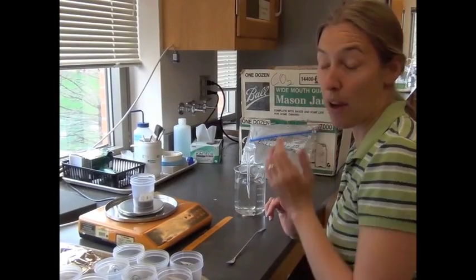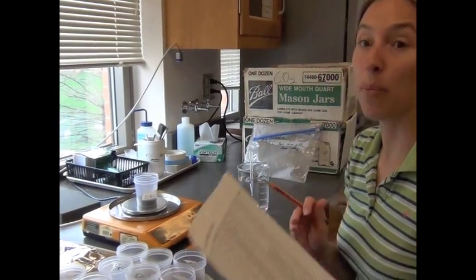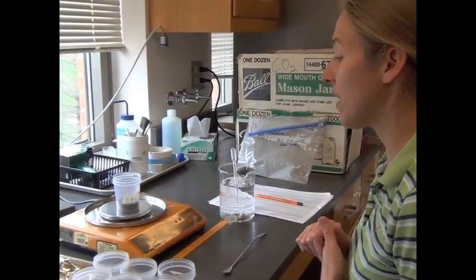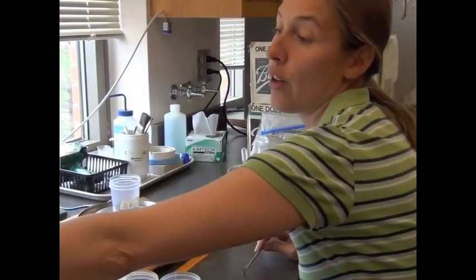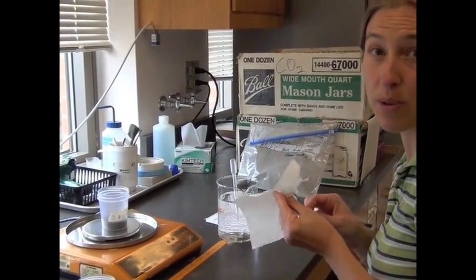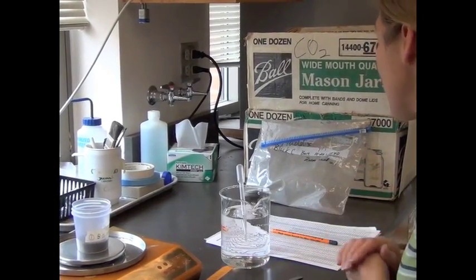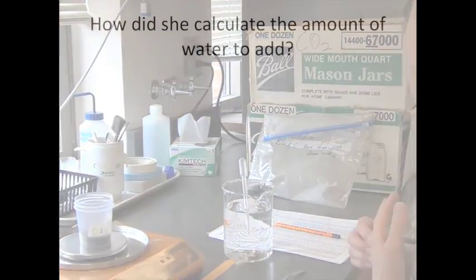The next thing I do after I weigh out my soil is wet it up to the appropriate moisture I want. In this experiment we're going to do 2 different moistures, and in advance I had already calculated that I need to add a certain amount of water to get to a particular pore space. For this sample I'm going to do 50% water-filled pore space. So I have 32 grams of soil, I have the cup, and to get to 50% water-filled pore space, I'm going to add 4.97 grams of water.